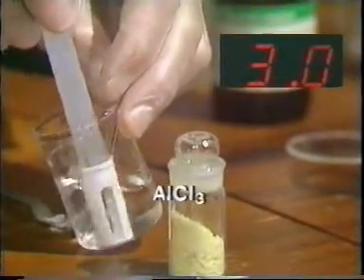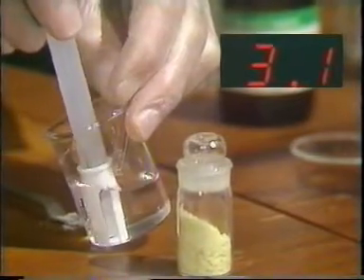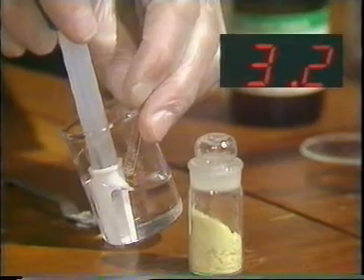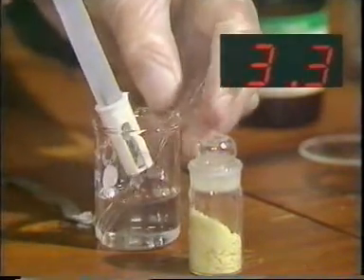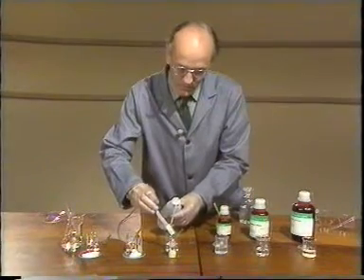Now here we've got a very definite fall in pH down to 3.2. Rinse the probe carefully.